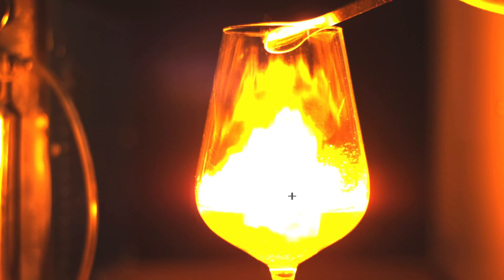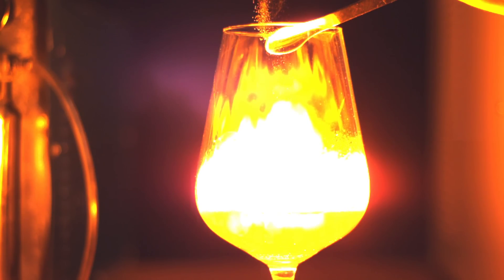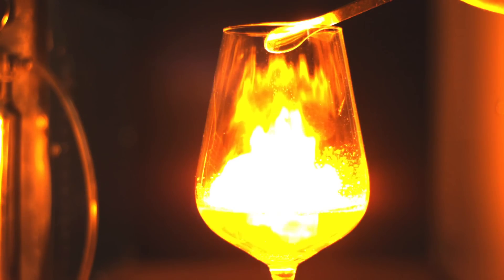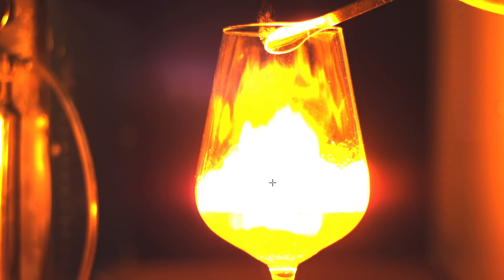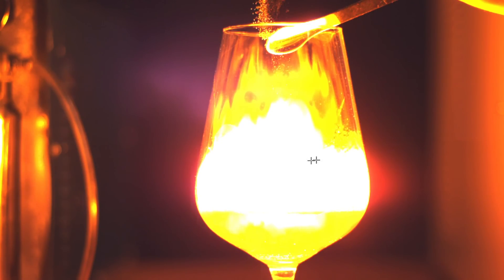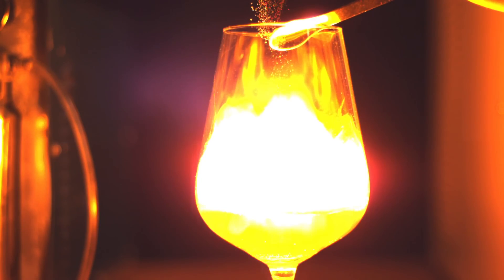It's clear it's generating loads of hydrogen already, and it's just this one little ignition source that burns everything. Of course when it does that it also generates loads of heat, and these hydrides decompose when they get hot. So it's just an auto-catalytic thing — what you're probably looking at here is the combustion, but it's not so much the powder; it's that the flame gets hot enough that it decomposes the sodium hydride, and yeah, that's what gives you the rest.